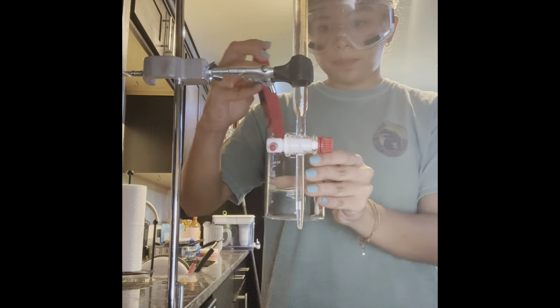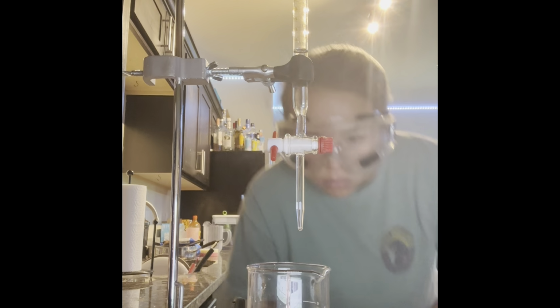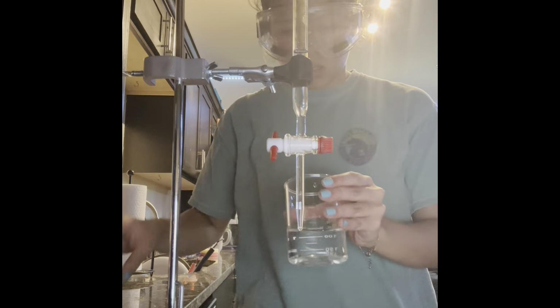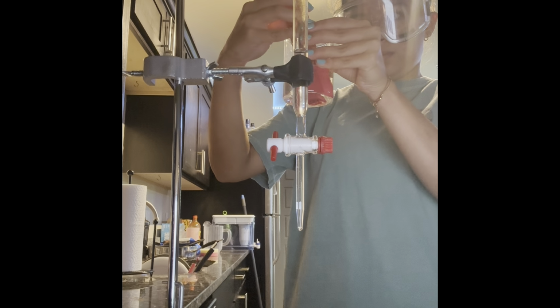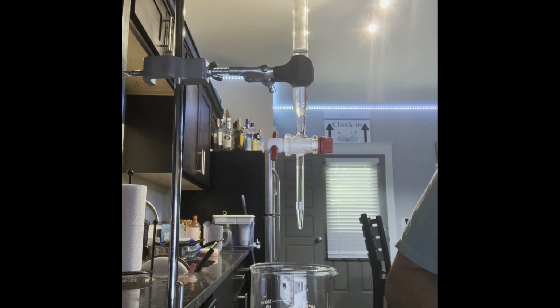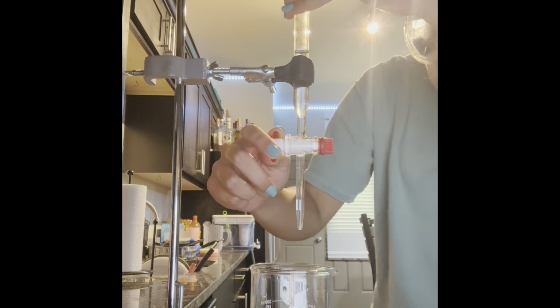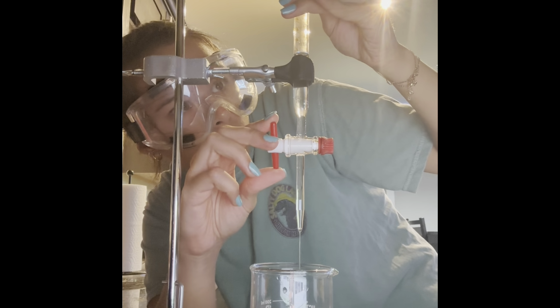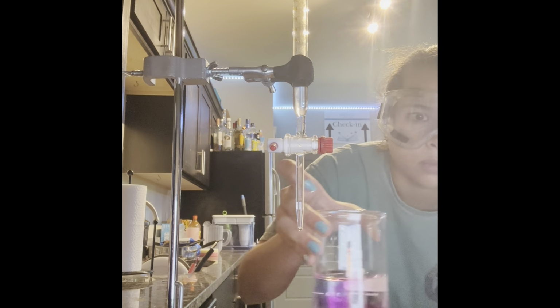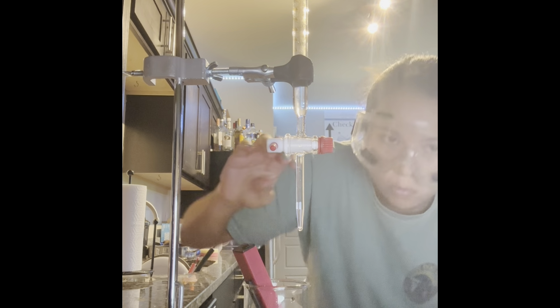The pH is at 3.9. Still disappearing. 4.5. Hmm. 4.6.